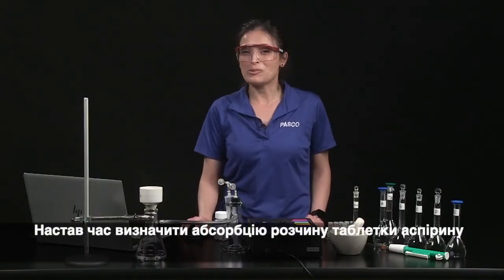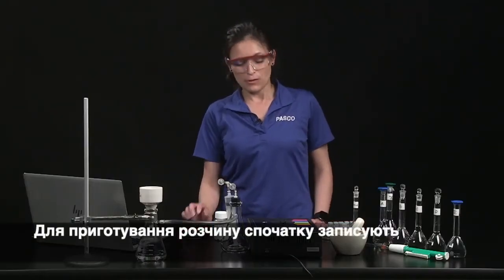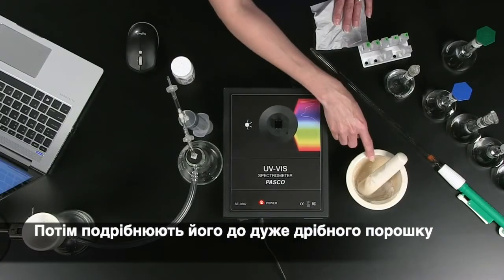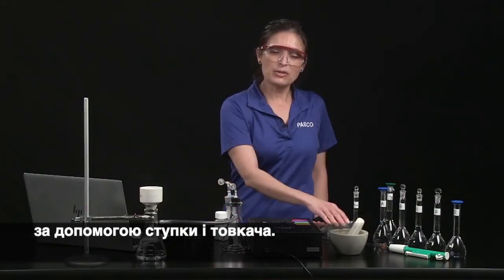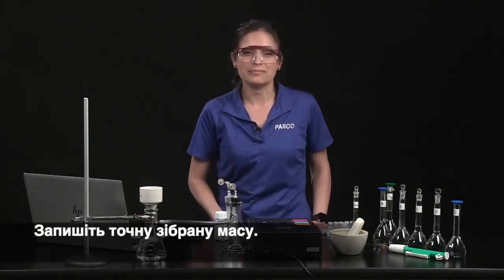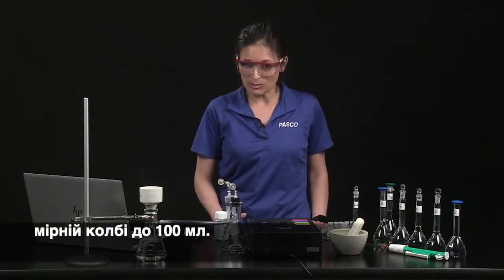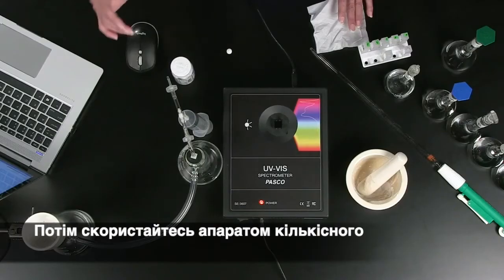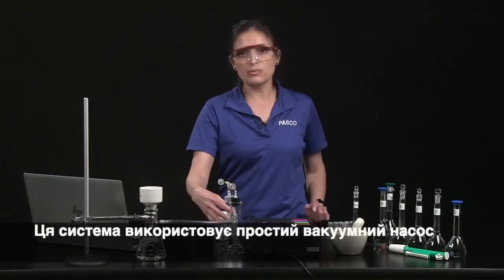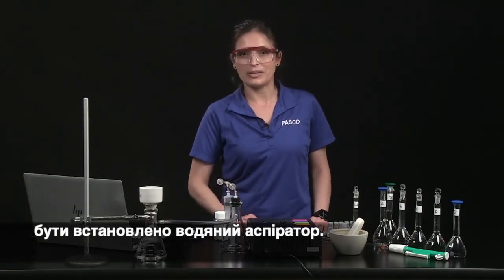Now it's time to determine the absorbance of an aspirin tablet solution. To make the solution, first record the exact mass of an aspirin tablet, then grind it to a very fine powder with a mortar and pestle. Measure about 0.04 grams of the tablet powder. Record the exact mass collected. Bring the solution to volume with ethanol in a 100 milliliter volumetric flask, then use a quantitative filter apparatus to remove impurities from the solution. This system uses a simple hand-operated vacuum pump, but your setup may incorporate a water aspirator.